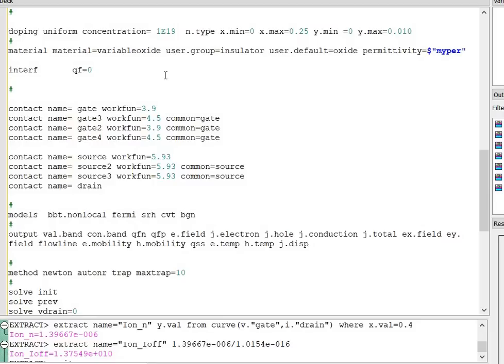The proposed material is insulator and the default is oxide. Having the permittivity, I have defined it as 12. In the previous code, I have already told you, you can define the permittivity at this place also. You can define 12 permittivity in the material statement.